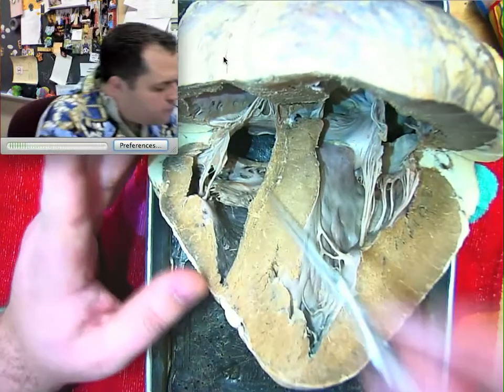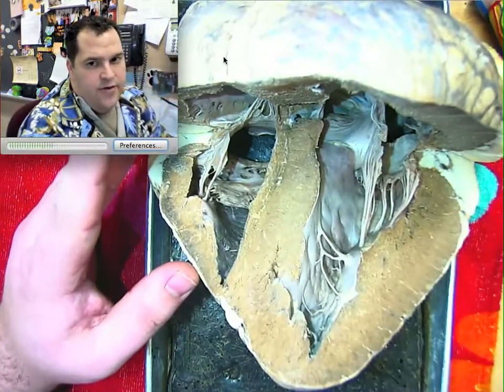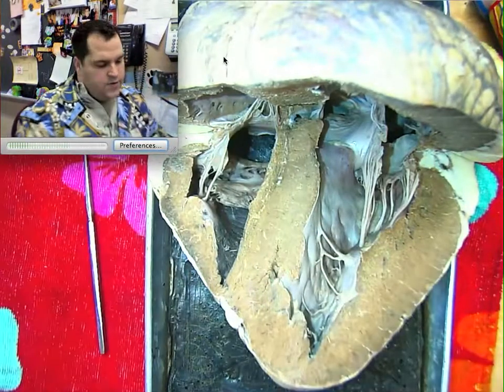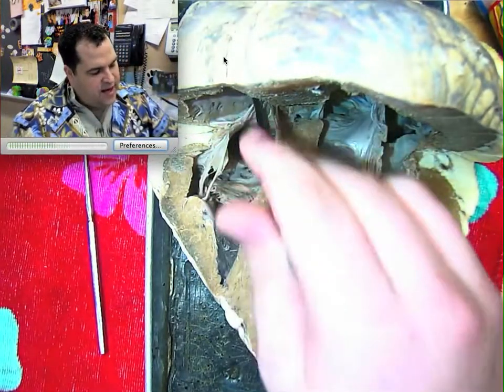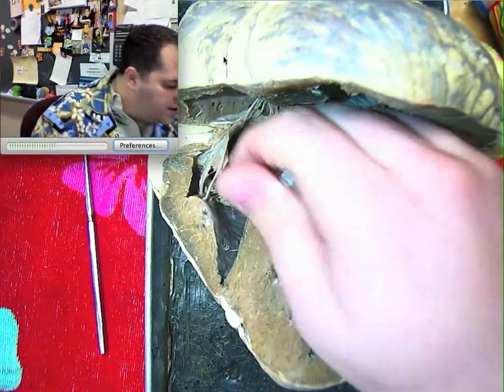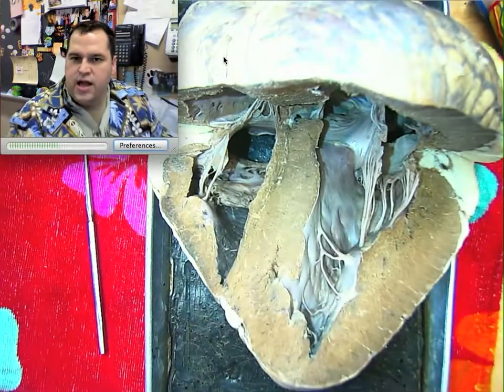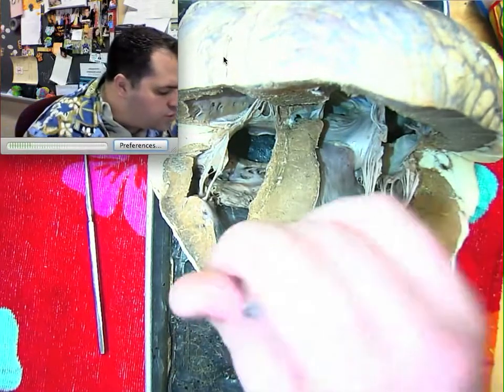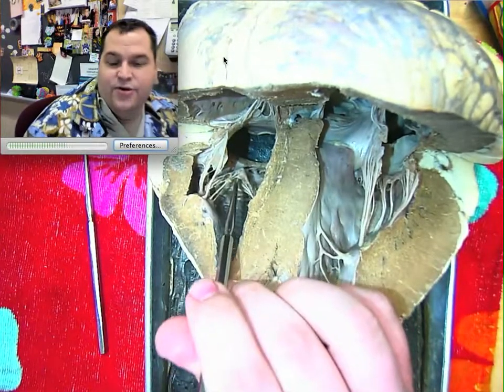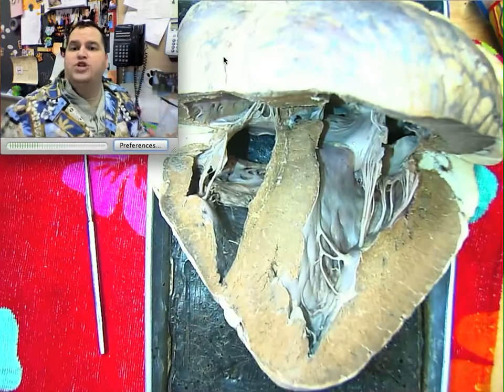Okay? But I want you to notice something else. Look at all this tissue in here. That's not just hanging out. Those have a purpose. These are valves of the heart, and they're one-way valves, because as blood comes down through the atrium, these valves push out of the way, kind of like a turnstile in an amusement park. But when the ventricle contracts, if we try to push blood upward, it's not going to get through, because the force of the blood actually closes the valve.